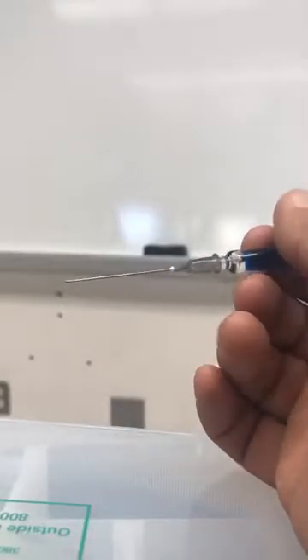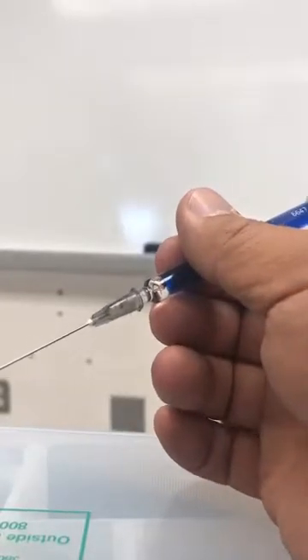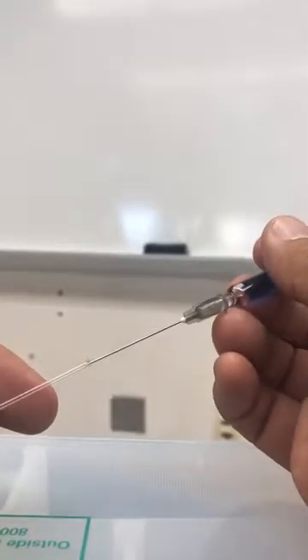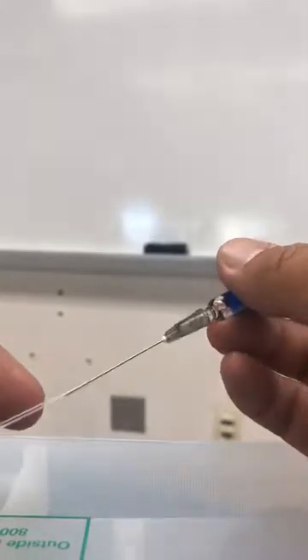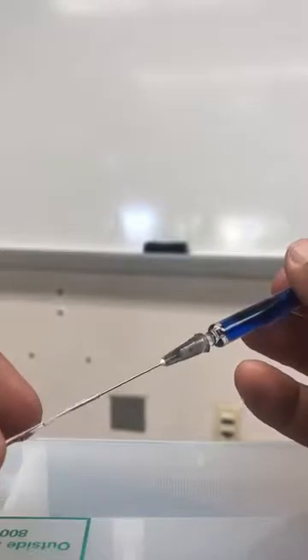So what you need to do next is put in a little bit of toluene or whatever sample that you're trying to do. Just give my finger for perspective. You don't need a lot of material to do the boiling point. In fact, I don't think you really want to fill it up very much. That was a little bit too much.